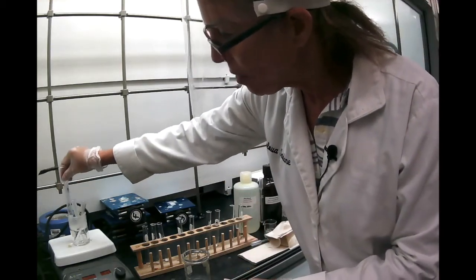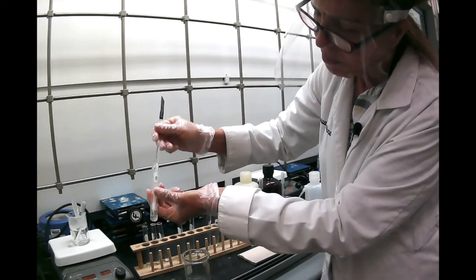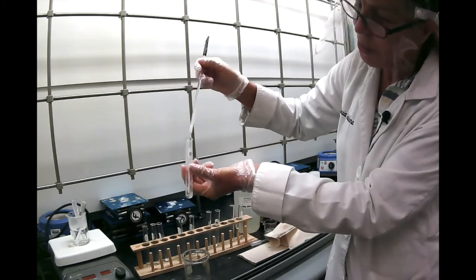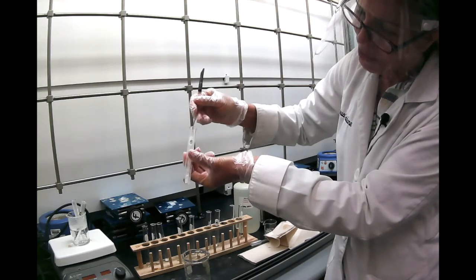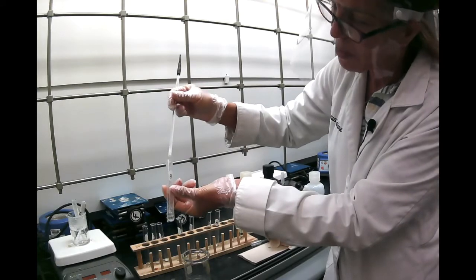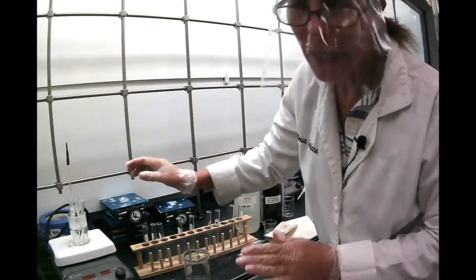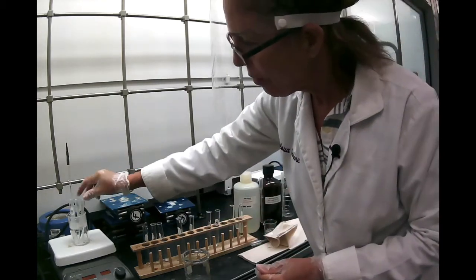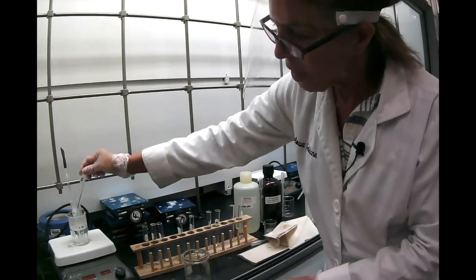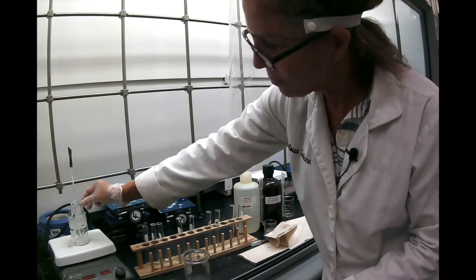So this was my naphthalene, and you see it condenses on the stirring rod. So it kind of dissolved, but it also condensed on my stirring rod. So I have to put it back into hot water. So it is kind of soluble, but not very soluble. This is benzoic acid, and it's not dissolving much, but we'll wait. And this is the acetanilide.